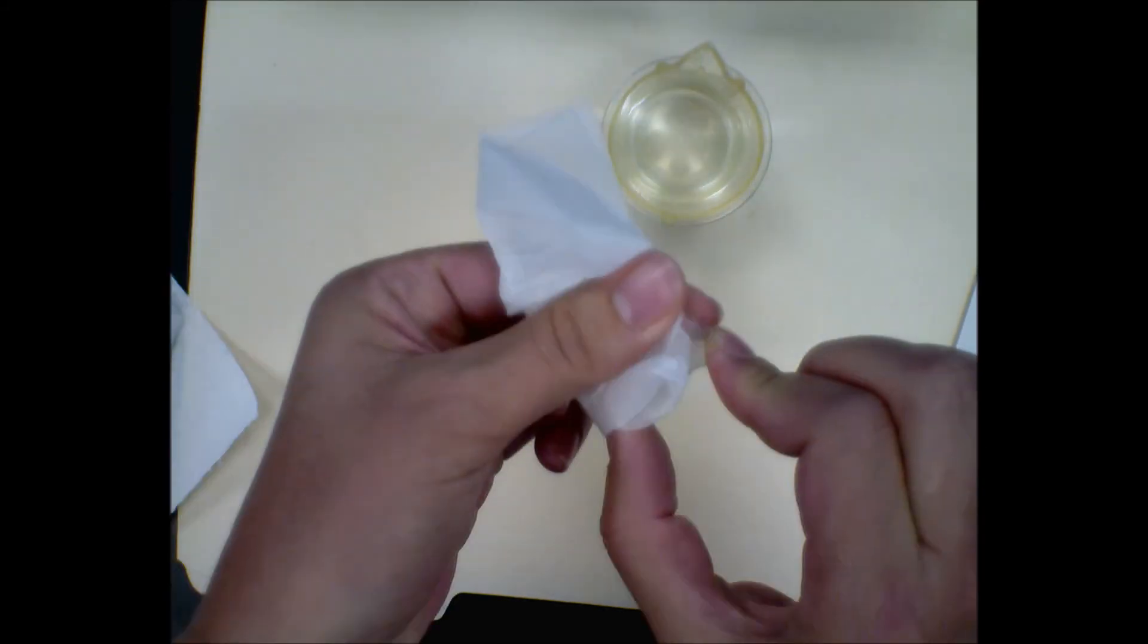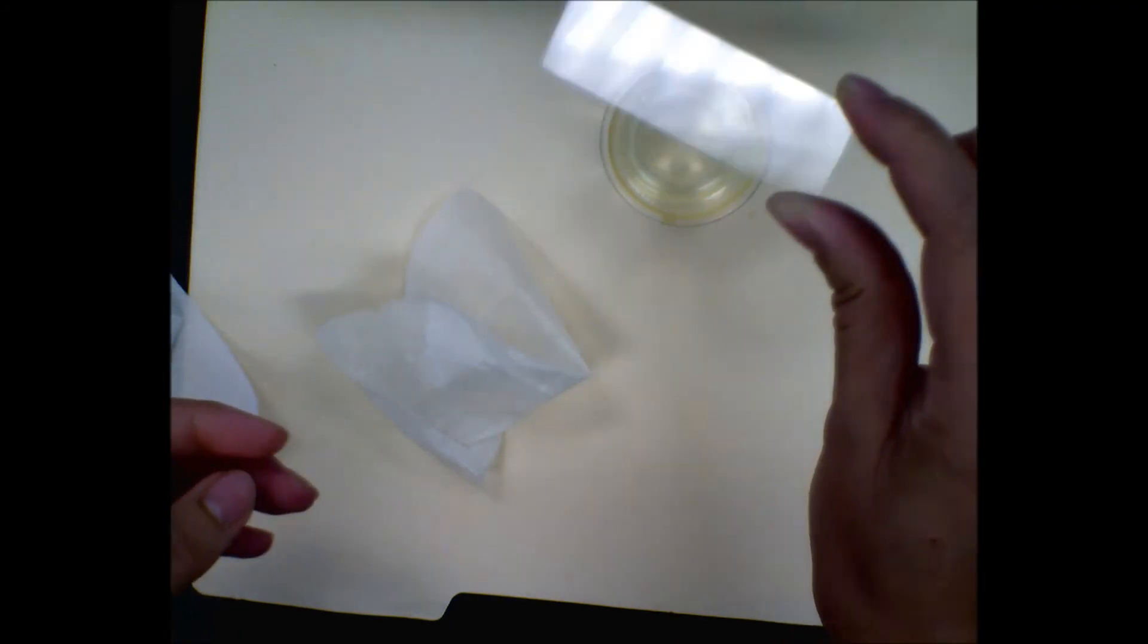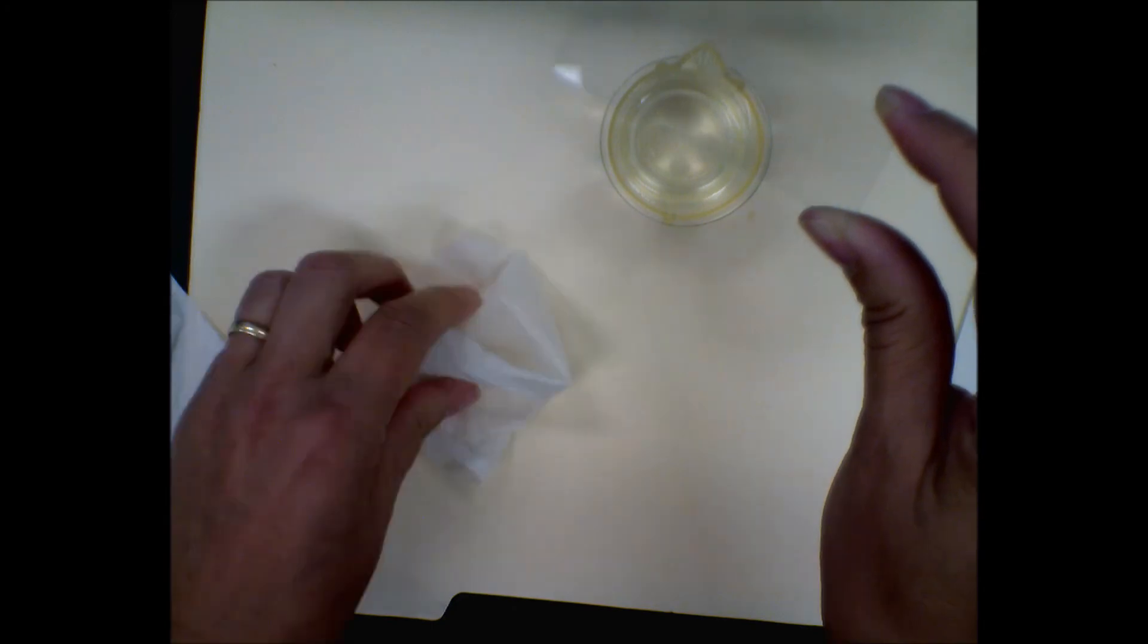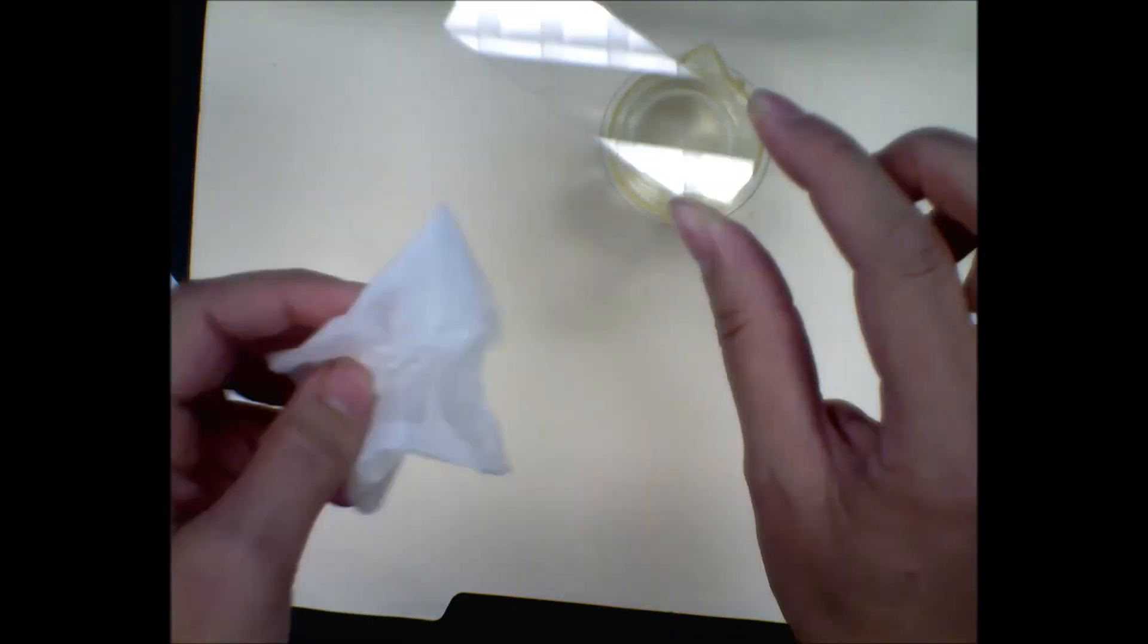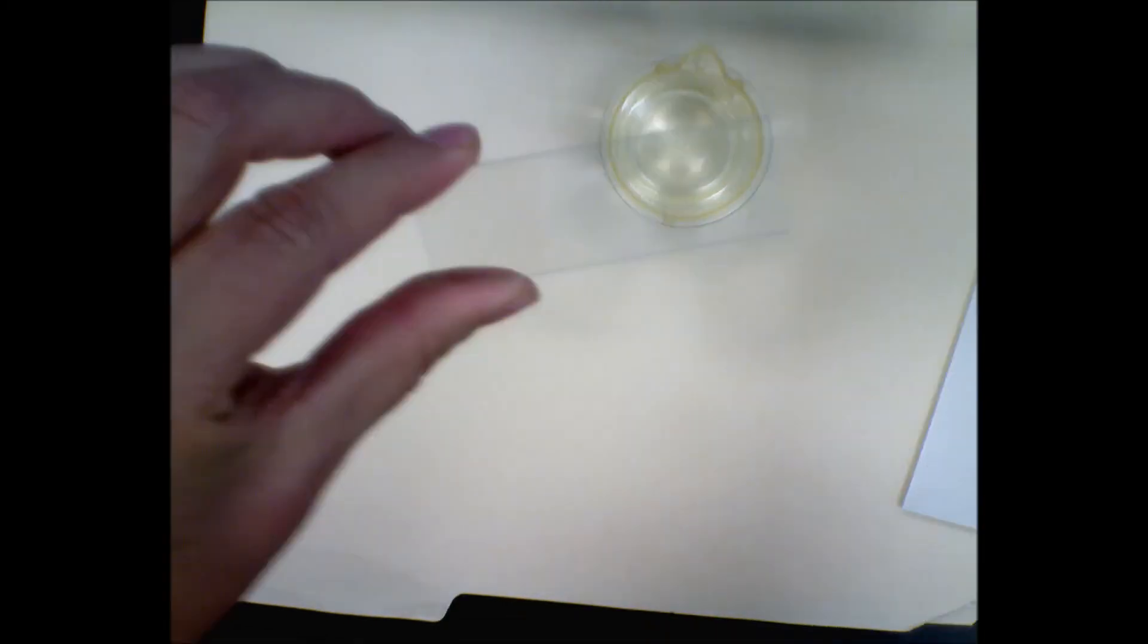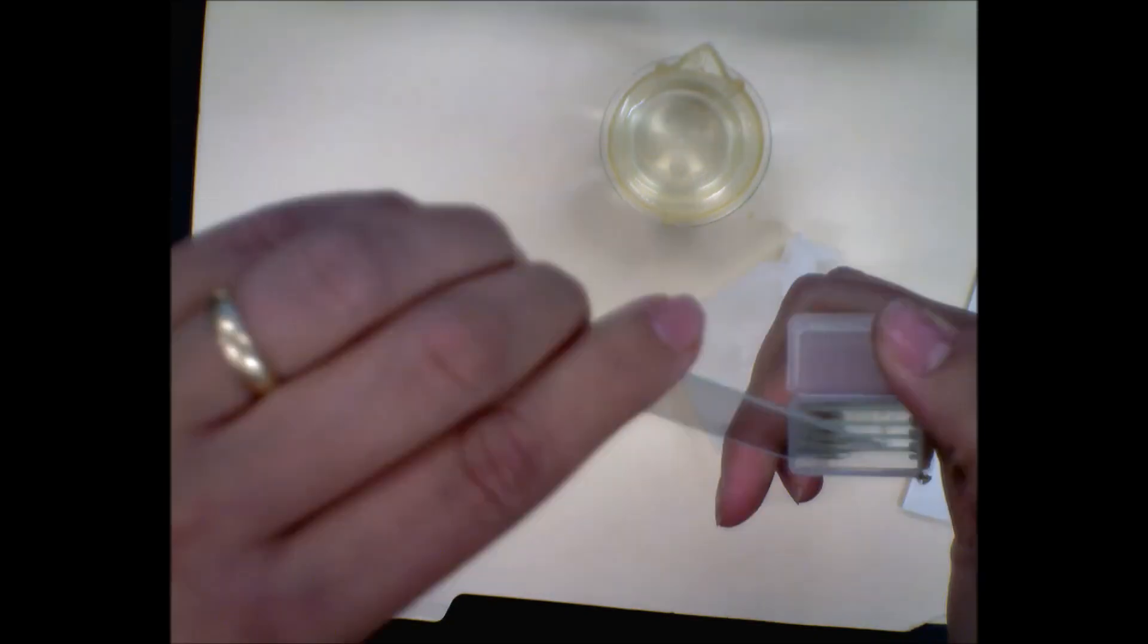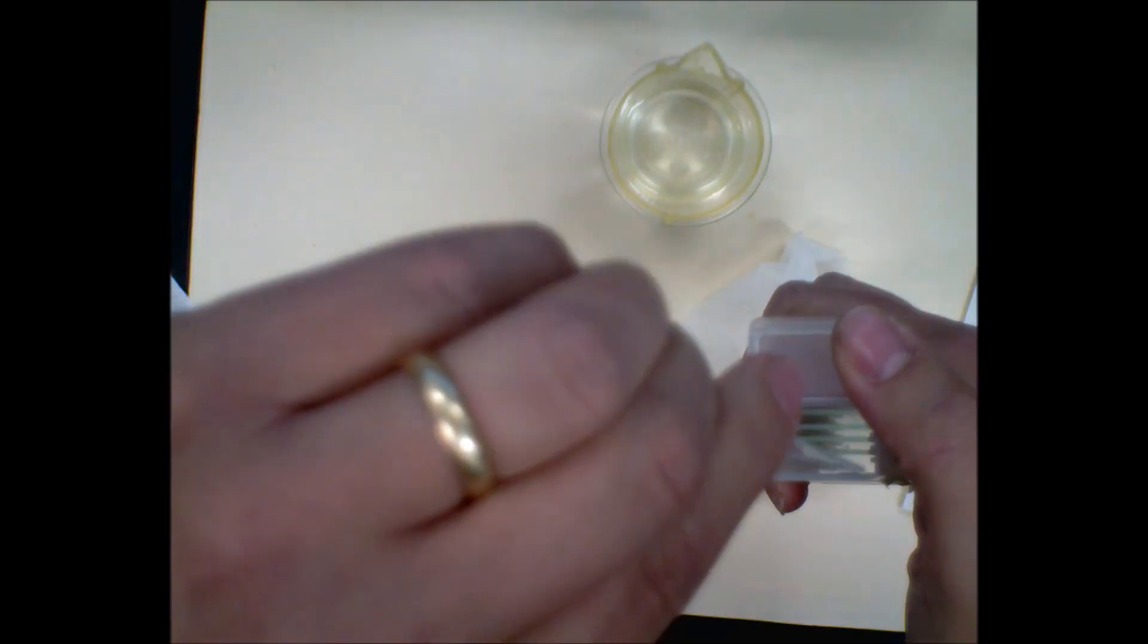So now then, that slide has been properly cleaned. If you hold it up to the light, you shouldn't see any smudges or smears or weird fingerprint parts. Do a double check and make sure you got all the gunk off from the paper towel, because I just saw some there. That's why I'm going back at it. And you pop it back into your case, and it's good for the next time. Cover slip goes back in its case, and you're done.